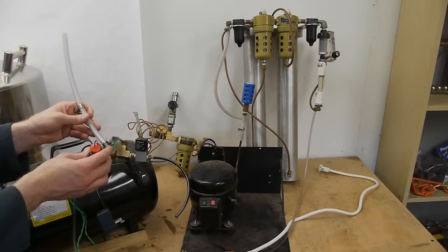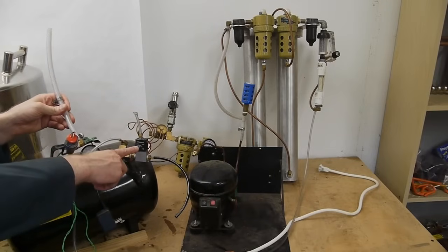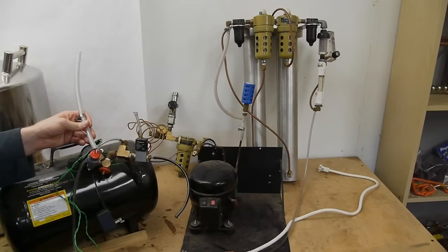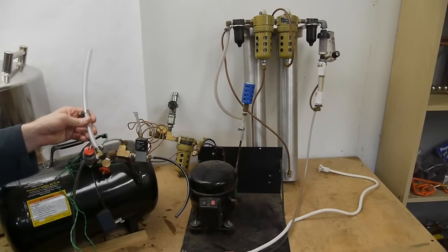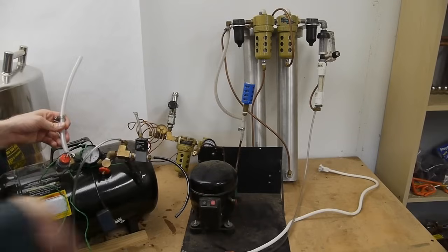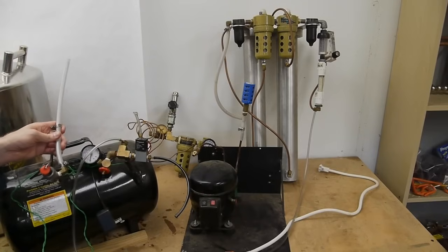Basically when it's fallen below a half a psi or something the valve opens and it sends nitrogen into the tank and when it gets up to a half psi it shuts off. So this whole thing is really just a dry nitrogen gas regulating system.